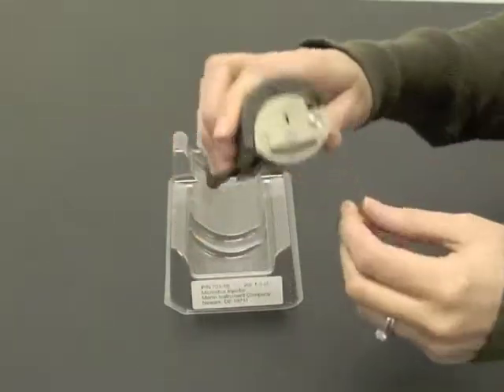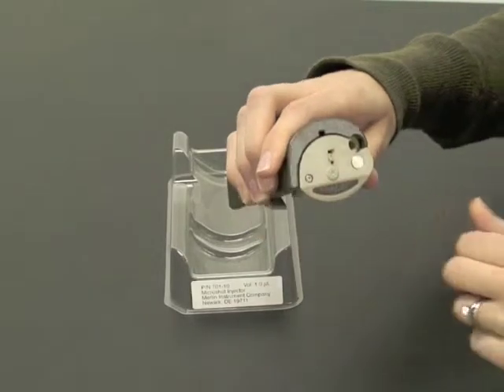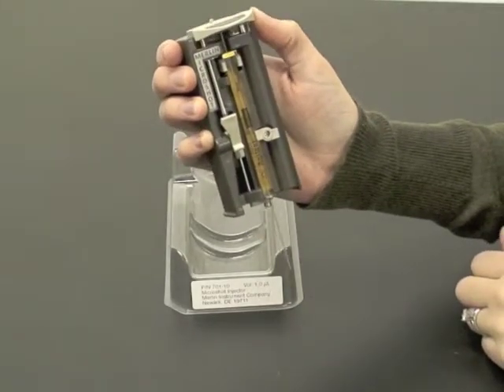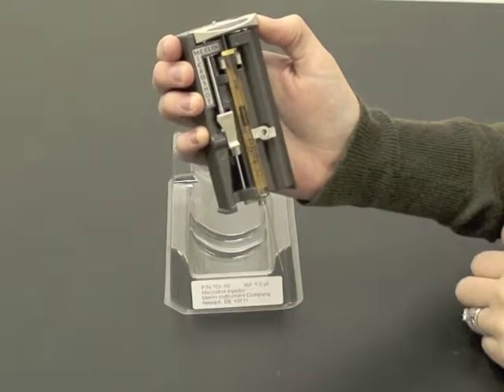Lower the plunger slide and release the plunger bolt to capture the syringe plunger. Now when you move the plunger slide, the syringe plunger moves.